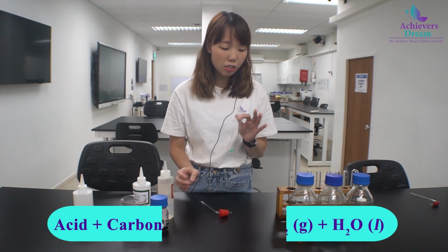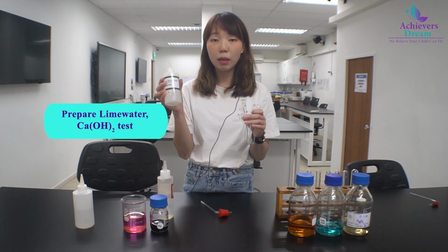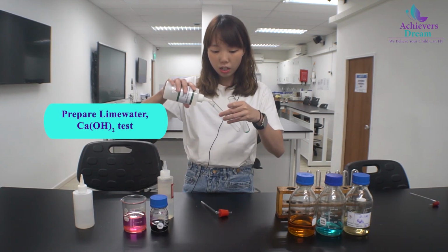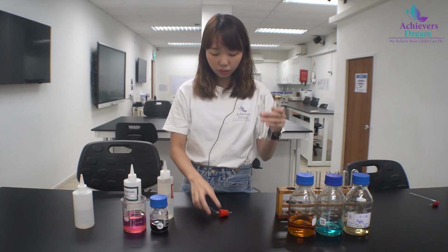So how do we test for presence of carbon dioxide gas? It is by adding in your lime water, which is calcium hydroxide. So first, I will prepare just a small amount of your lime water.